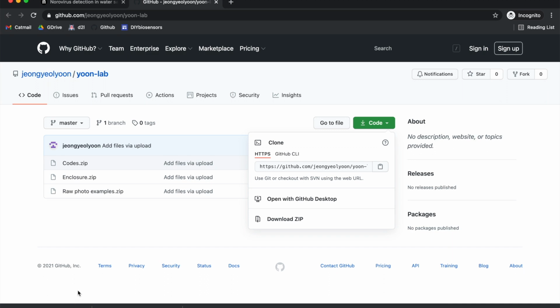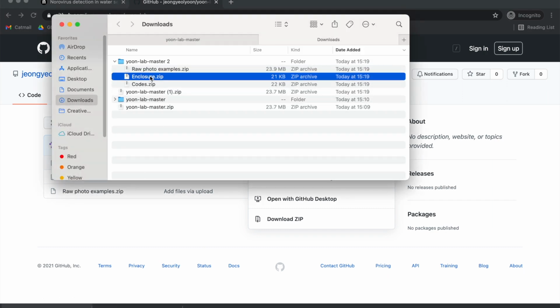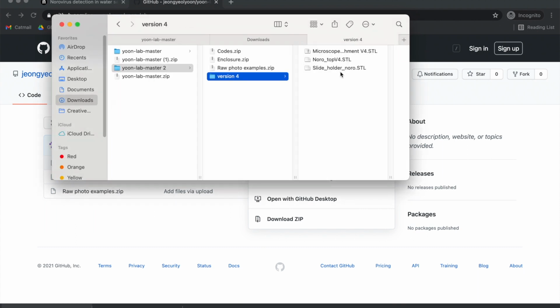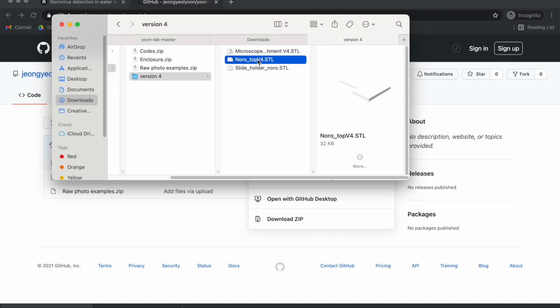This includes the code that we discuss in the publication, as well as the 3D STL files, so you can print it yourself, and then also a couple example photos. For now, we're just going to be looking at this enclosure. This has the 3D printed files. So, microscope attachment. This is the main portion that you're going to put in your microscope attachment, the one from Amazon. Then this is the lid, and this is the slide holder.